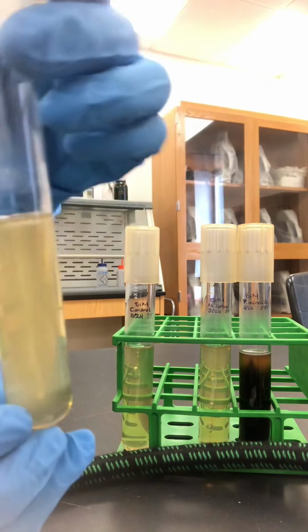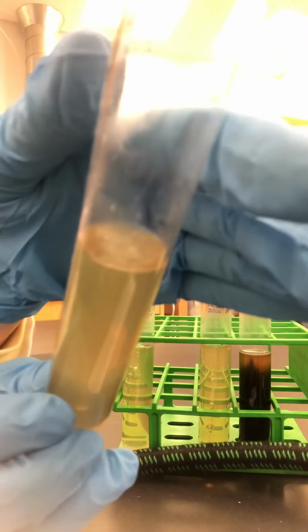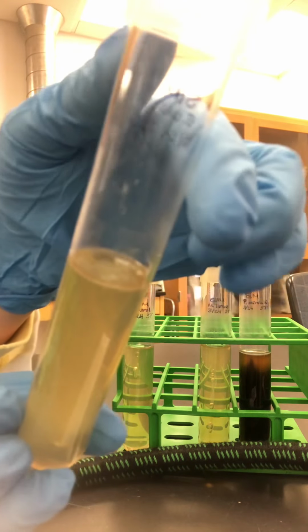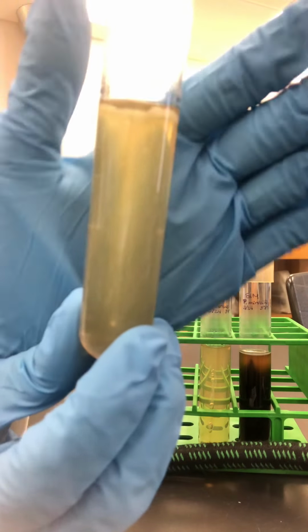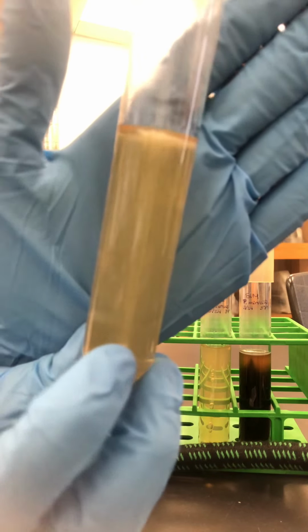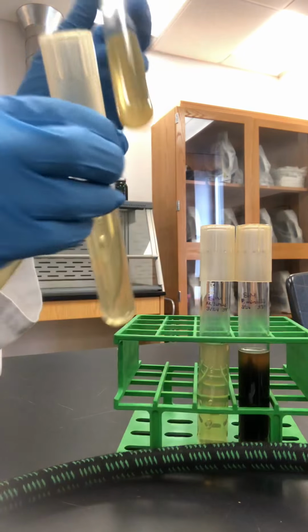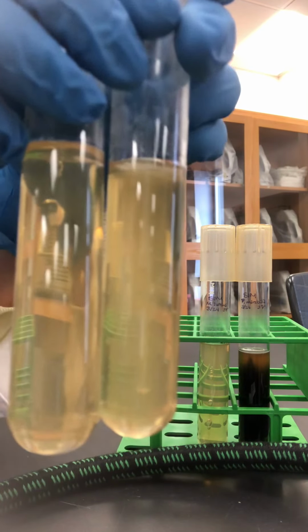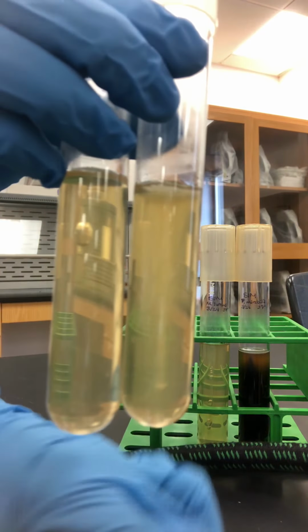We can see that there is some growth on the top there of the organism, like a whitish color of the culture. It's kind of hard to tell, but we'll compare it. It's turbid, but that is hard to tell. So comparing it just to the control alone, you can see that it has moved.